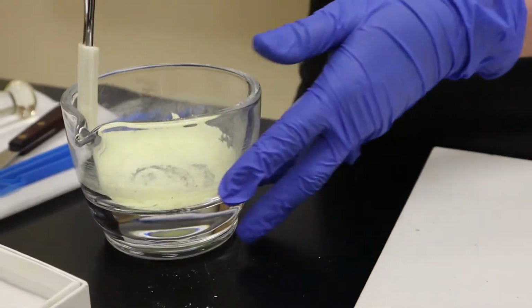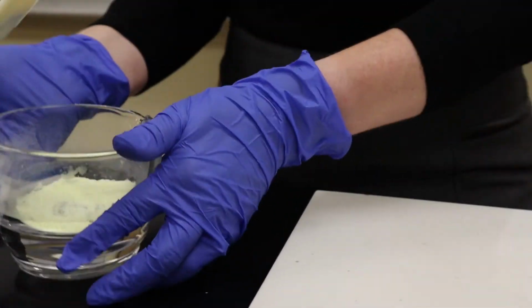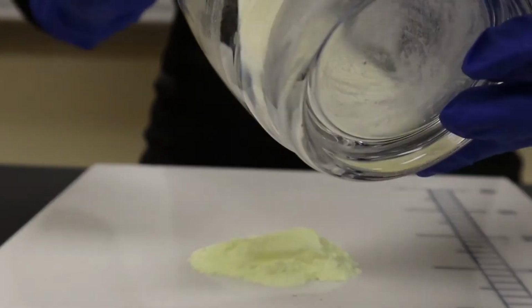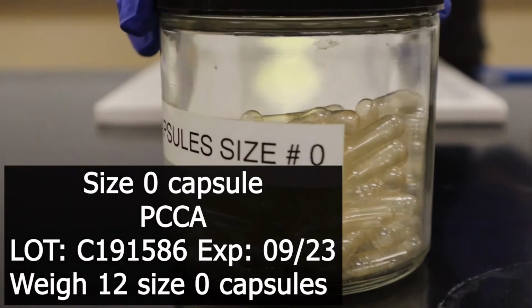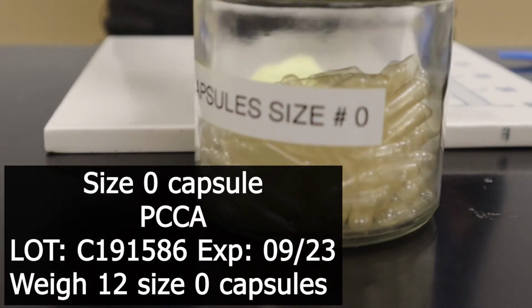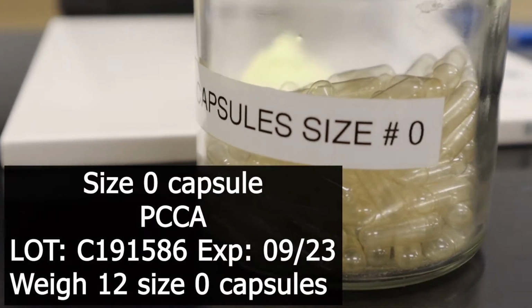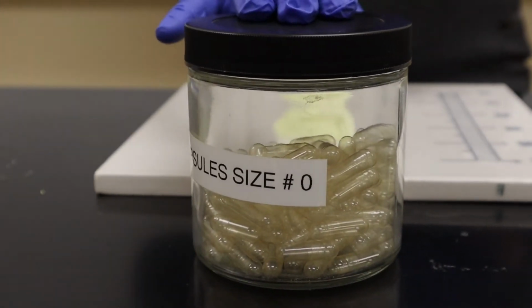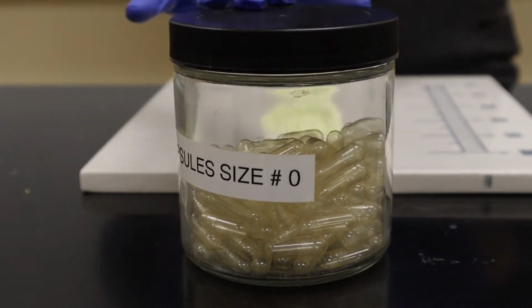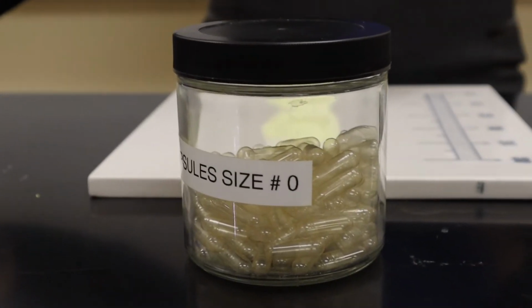Now that I have all of my powder ingredients combined together, I'm going to transfer all of my powder over to my ointment slab. Now I'm going to weigh out my 12 size 0 capsules and find the average weight of the size 0 capsule and then add that to the 455 milligrams that's my target powder fill weight in order to calculate what my final target weight should be for each one of my capsules.